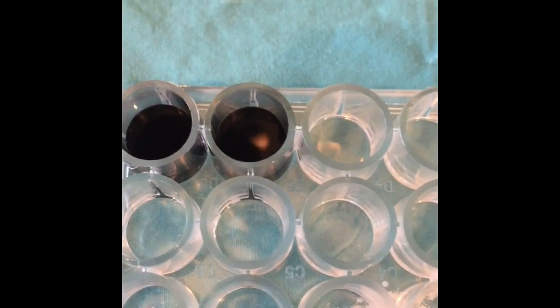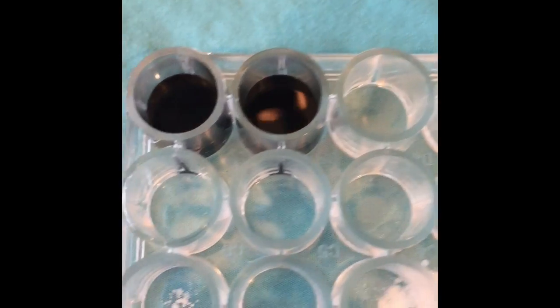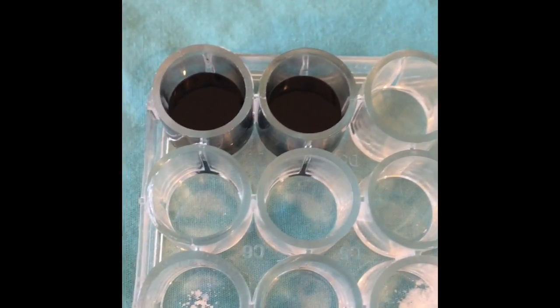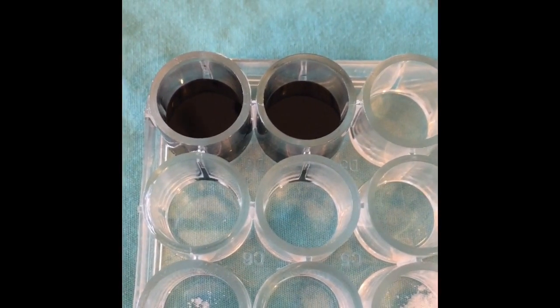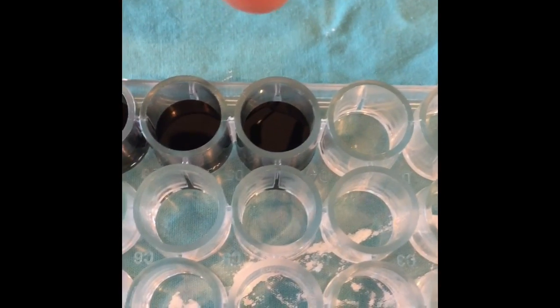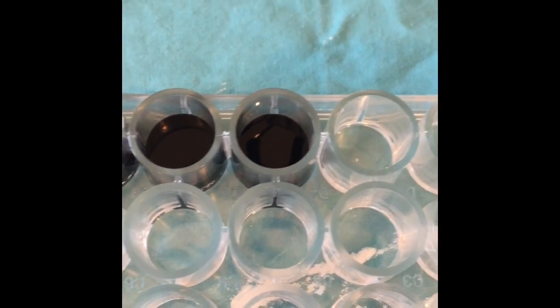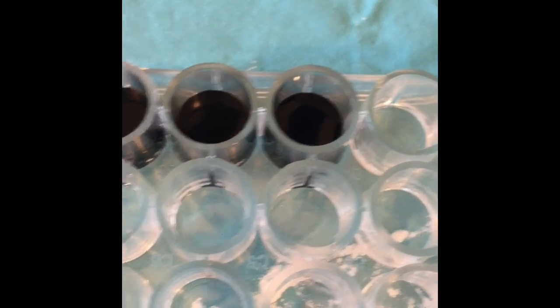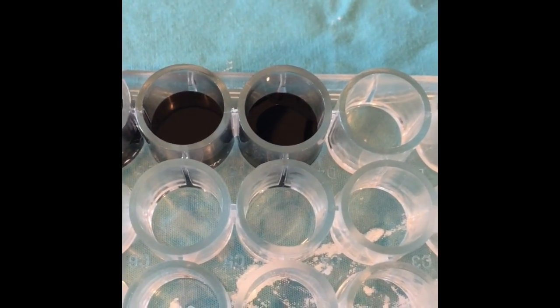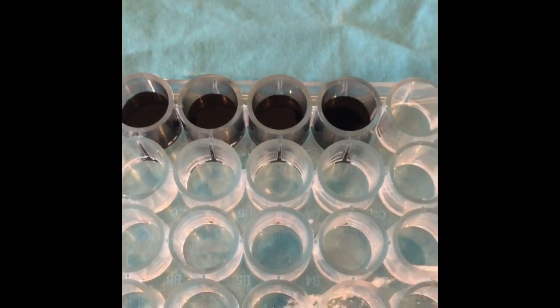This second trial took approximately 27.31 seconds to turn completely dark blue, so I will be decreasing the number of sodium thiosulfate drops to 5. For the third trial, I decreased the number of drops of sodium thiosulfate to 5, but it still took approximately 24 seconds, so the next one I'm going to decrease down to 4 drops. The fourth trial took approximately 20 seconds, so the calibration tests are complete.